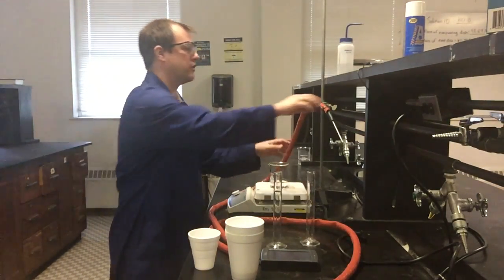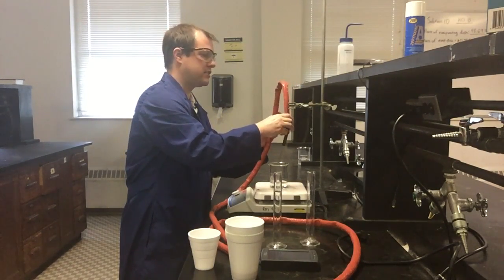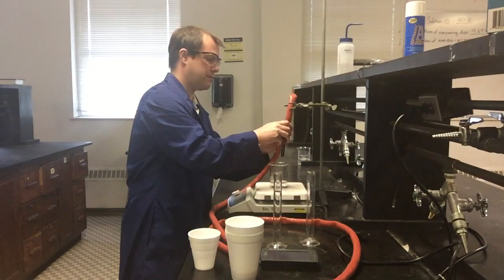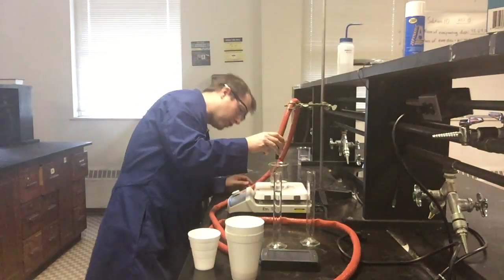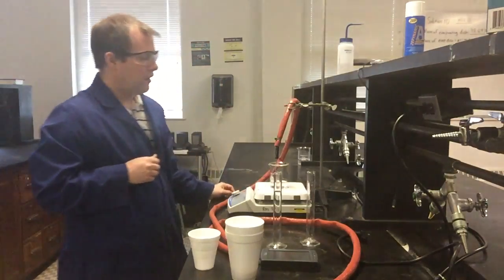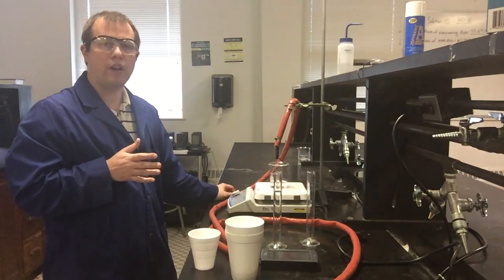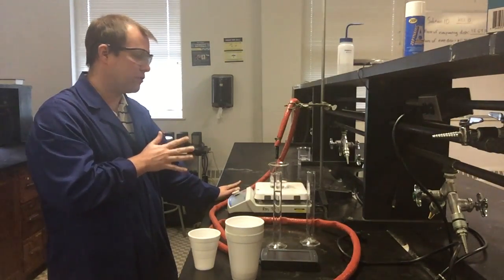I have a thermocouple over here that I've got set up that I was waiting to do this with. And what I'm basically going to do is get my thermocouple set up here just into the water itself so that hopefully it's not touching the bottom there. Okay. And I'm going to go ahead and heat this water up to somewhere around 40 degrees Celsius or so, not terribly hot.